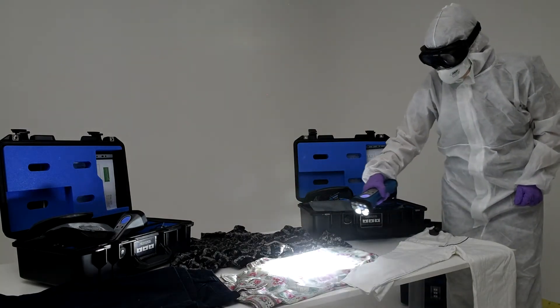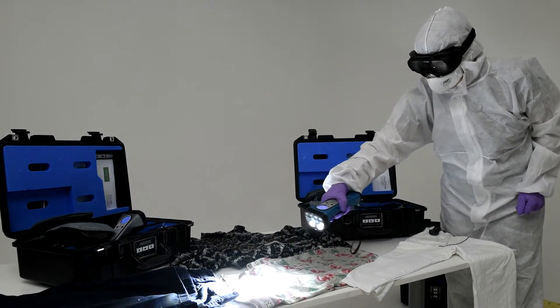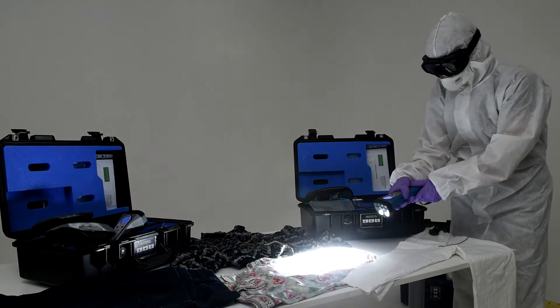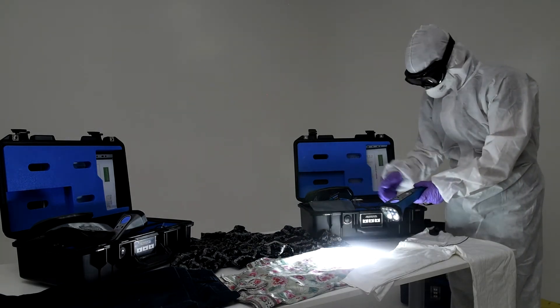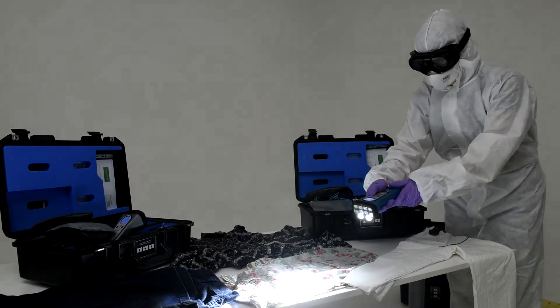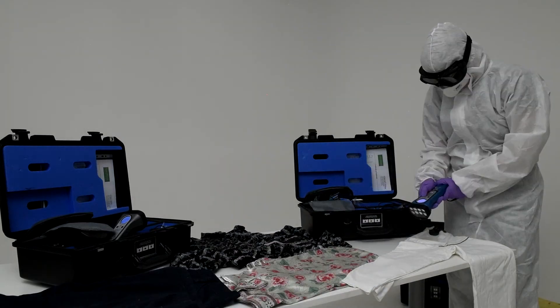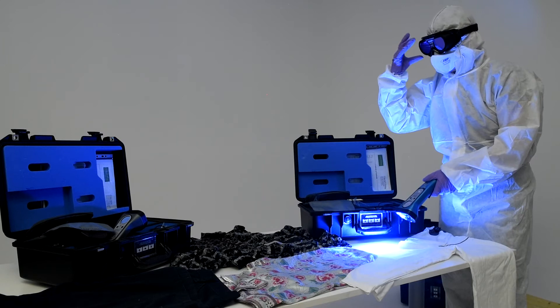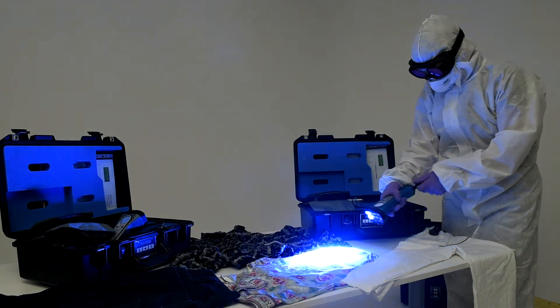It's important to understand that not all body fluids will fluoresce under the same light source, and that's why it's important to have a range of wavelengths. In this next example, we actually have a semen sample. Our CSI searches with a white light source, then switches to a blue-green light source and adds a 550 long-pass magnetic filter to the ProVision goggles. The CSI is now able to screen this set of pyjamas using the blue-green light source and can visualise multiple areas of staining.